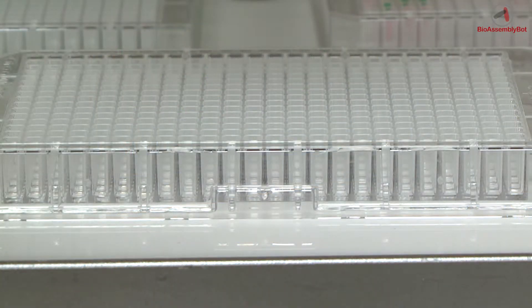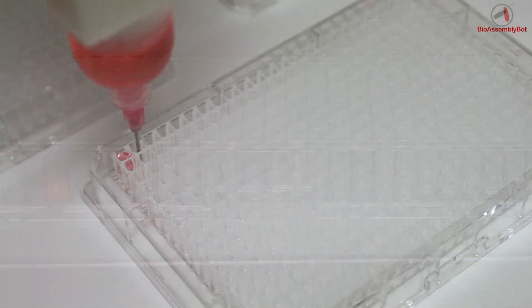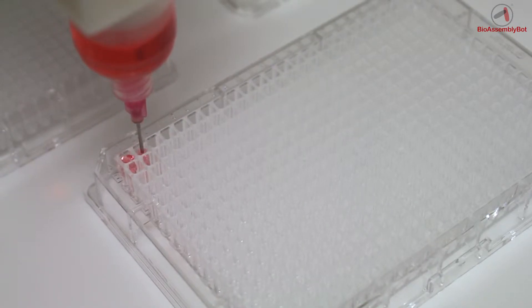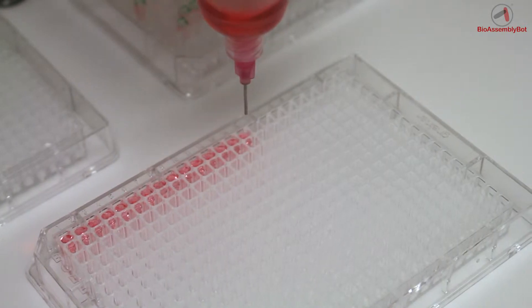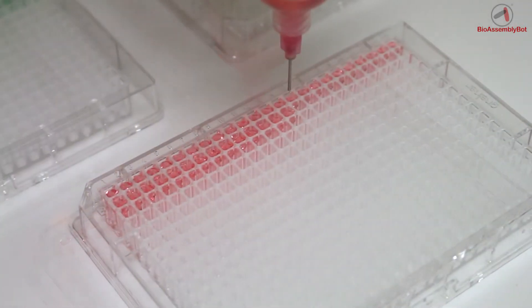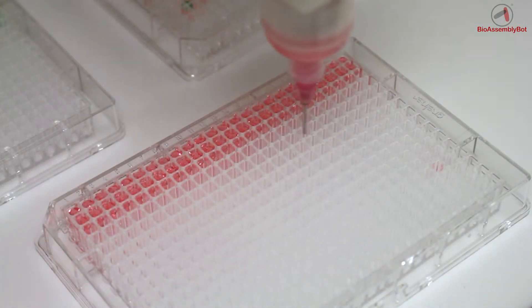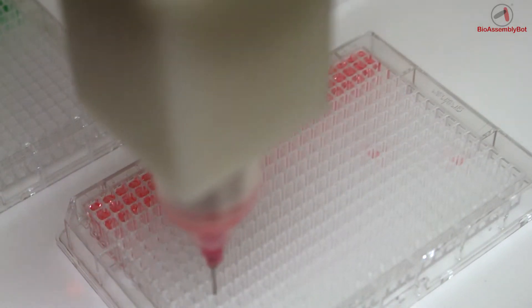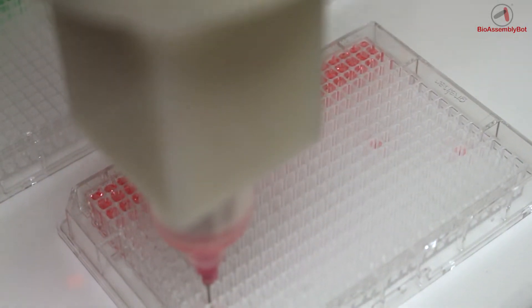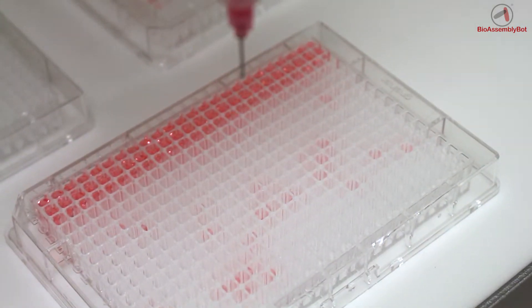Once constructed in TSIM, the BAB printer is instructed first to deposit in two phases cell matrix compositions that are reproducibly done in an automatic fashion. In this case, we'll go through two complete rows of this 384-well plate. Here, BAB is instructed to print single-deposition cell matrix constructs in specific predetermined wells of the 384-well plate.